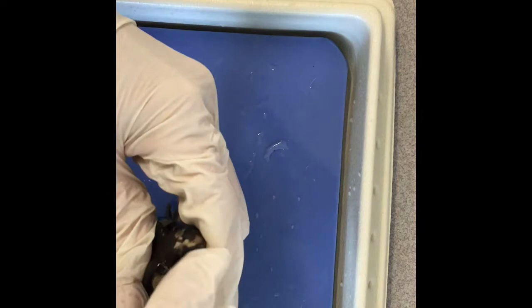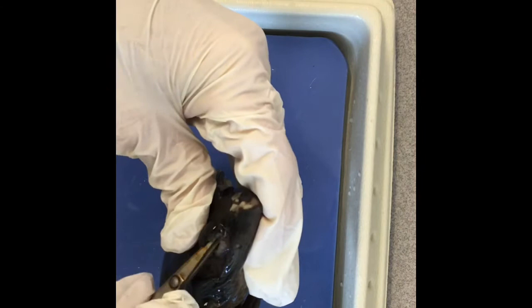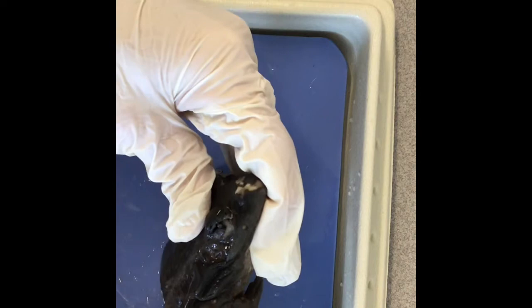So you can see that is the lens, or the eyeball. It feels pretty cool because it feels kind of like glass. That's the lens of the eye. And again, the nictitating membrane is this clear protective layer so the frogs can see underwater.